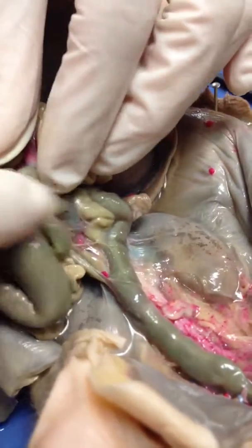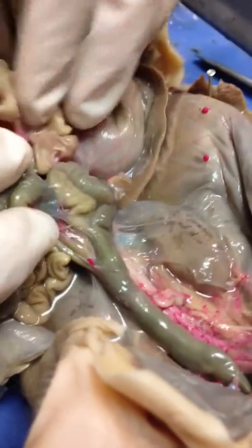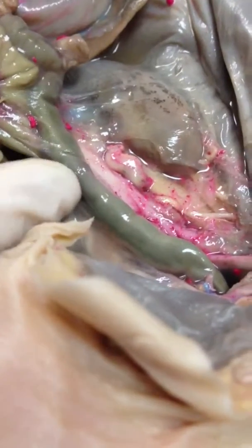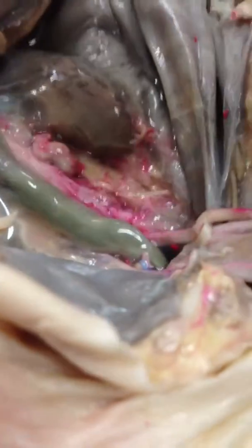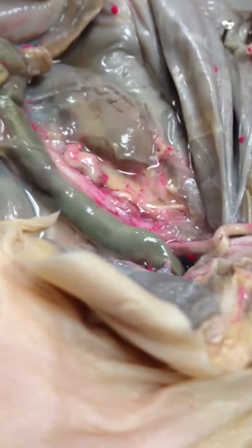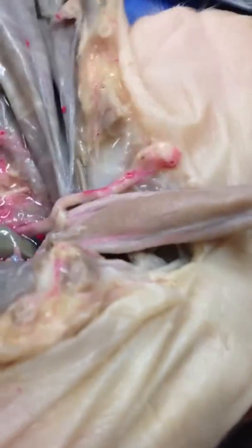Alright, so from the large intestine, it goes into the rectum. So the rectum is the passage of the feces. If we look at the mucosal layer, what will we see a lot of there? Goblet cells, good. And then from the rectum, externally, we have the anus. Okay? If we were going to pin the rectum or the anus, it would just be rectum, just right there. Anus, right there.